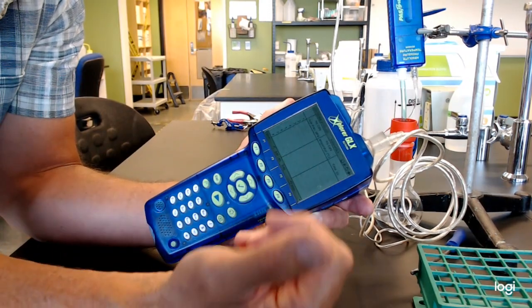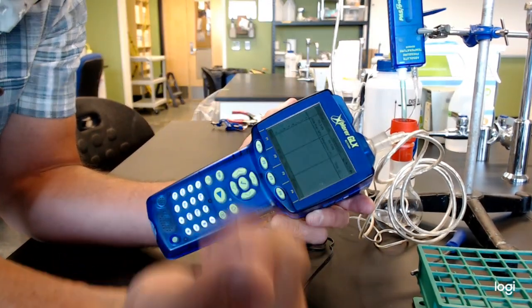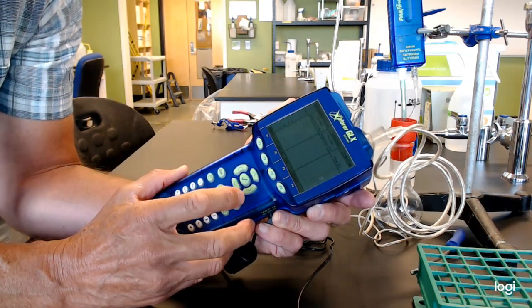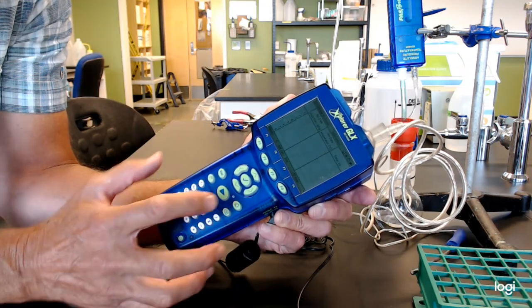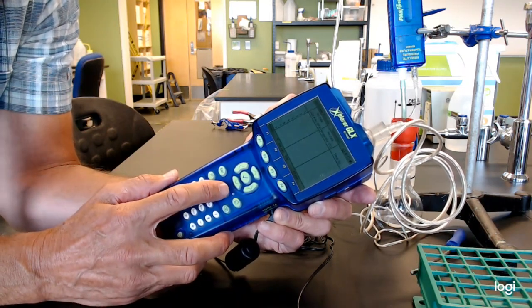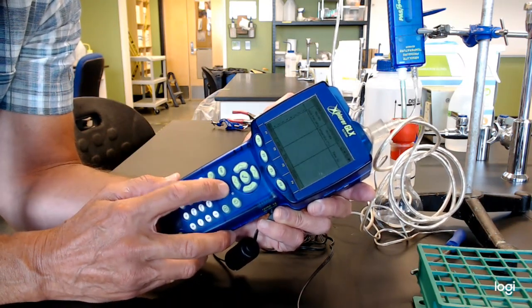Just so you understand how you can add columns and take columns away. And then you assign what's in the column. Always go to the heading, highlight it, drop it down, and then you can choose what you want to run in that column. When you're ready to take data, it's very straightforward. It's just play and stop with the same button. So I'm going to start taking data.